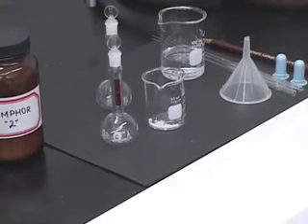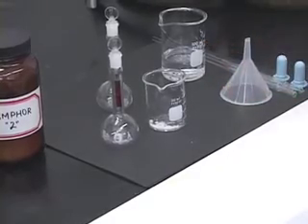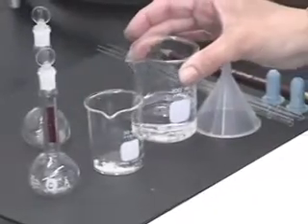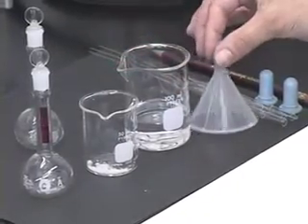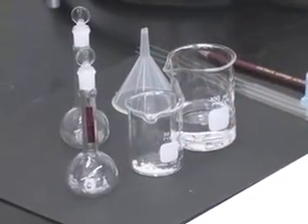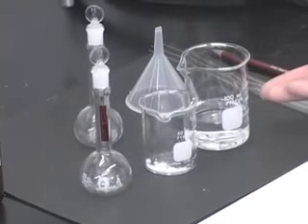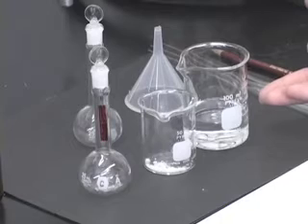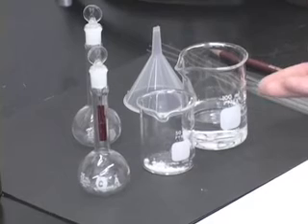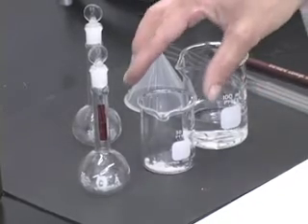Once you have finished weighing your camphor, take some 95% ethanol in a beaker. Here is 95% ethanol, which I have taken in a beaker. Since we are preparing the solution in a 25 milliliter volumetric flask, I do not need much more than about 40 milliliters of ethanol in this beaker. So please start off with no more than 40 milliliters of ethanol. If you need more, you can always get some more.